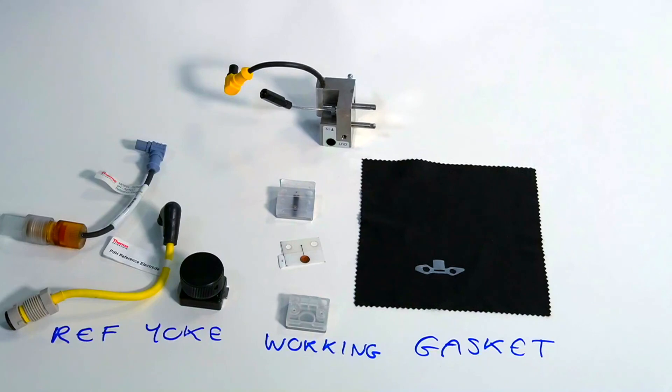The rest of the cell is the zero volts. This whole body basically is your zero volt cell.